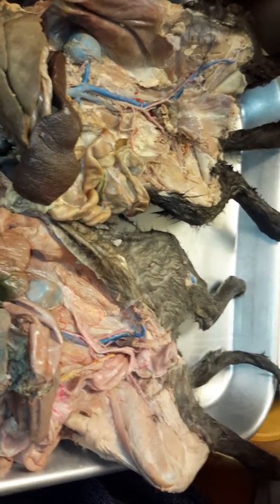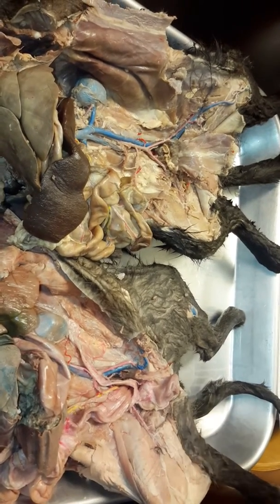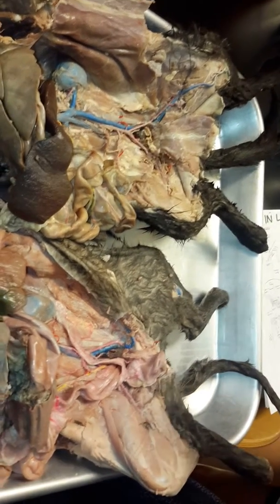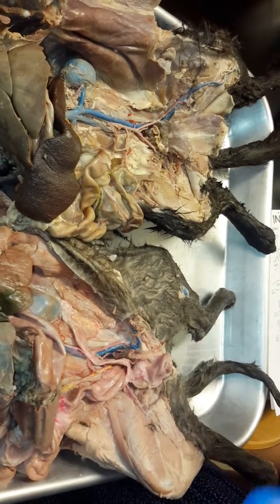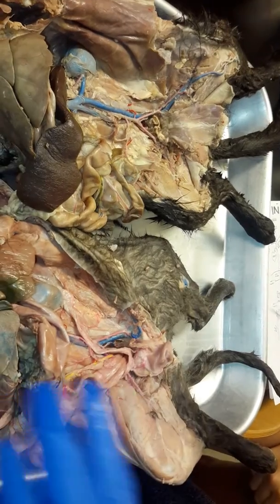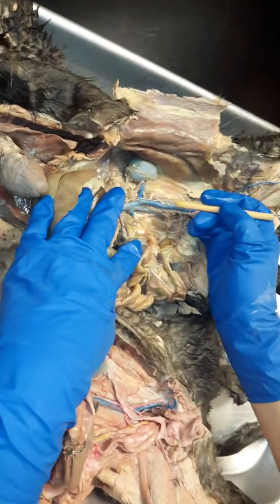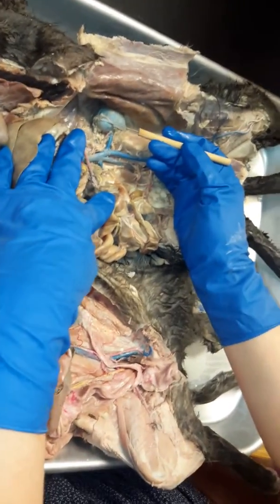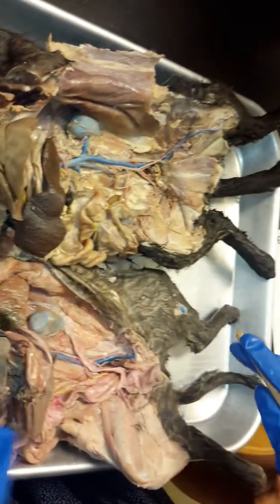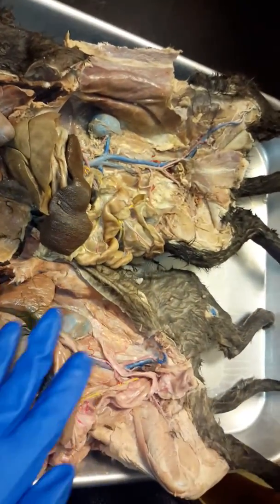And don't worry about the adrenolumbars. All of these cats, they've been kind of cut away and they're hard, but I'll tell you about it, but you don't have to identify it. The adrenolumbar artery and vein are the arteries and veins that are going to go to and from the adrenal glands. That's why it's called adrenolumbar. Okay, so it's going to supply blood to the adrenal glands. So normally you would see it coming off the abdominal aorta or the inferior vena cava and going to the top of the kidney because that's where the adrenal glands are, but they've been cut away so you can't really see them. So don't worry about that. Just worry about the ones that I went through with you through the cat.